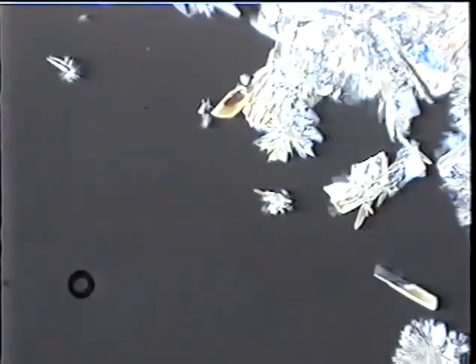This is the supercooled melt of cholesterol acetate, and it's now crystallizing, and we'll see in a second the liquid crystalline form nucleate. There it comes, and it's grown kind of smoky, and it grows across the field very rapidly. It's a liquid crystalline phase. It's a polymorphic form of cholesterol acetate, and it has no backbone. It flows more or less like a liquid. This is the solid phase of cholesterol acetate growing through the liquid crystalline phase.